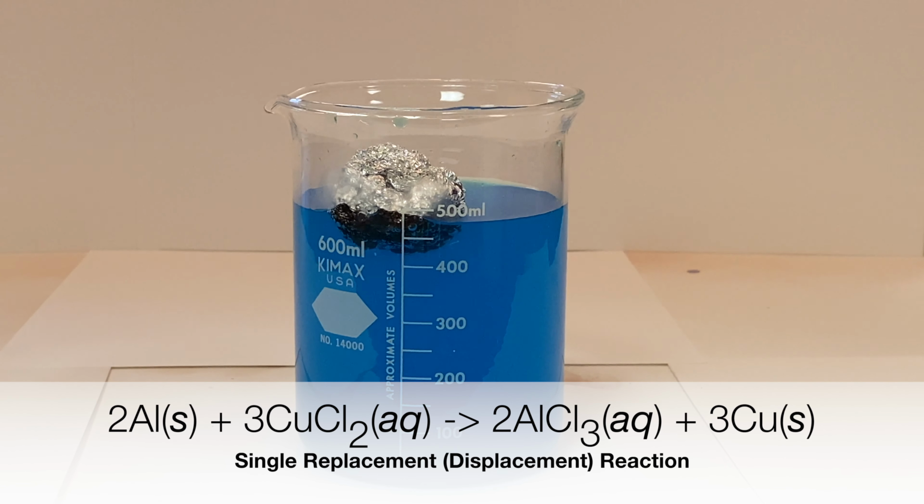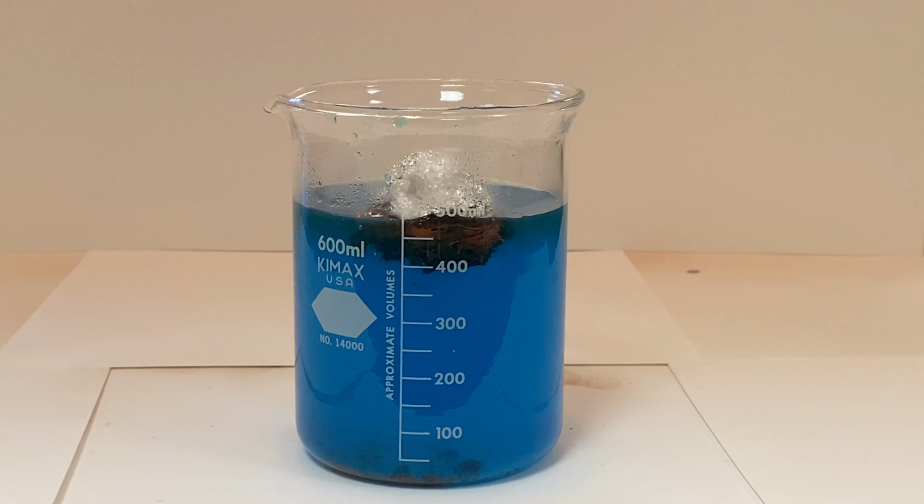The copper starts to become more clear as it forms because we can see its characteristic color. As the reaction progresses, the aluminum starts to get consumed and it starts to disappear. The reaction continues and more copper forms and it starts to fall to the bottom of the beaker.